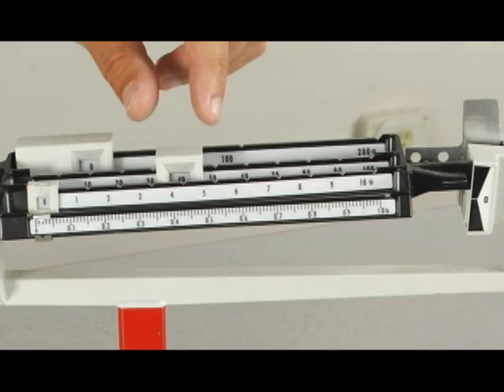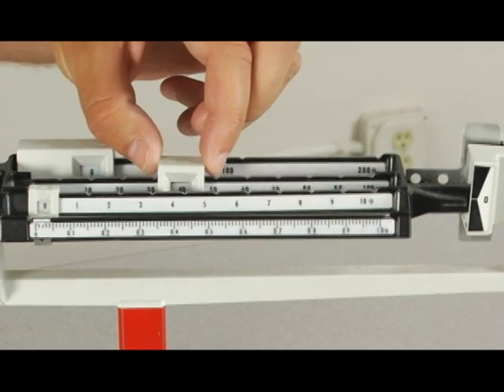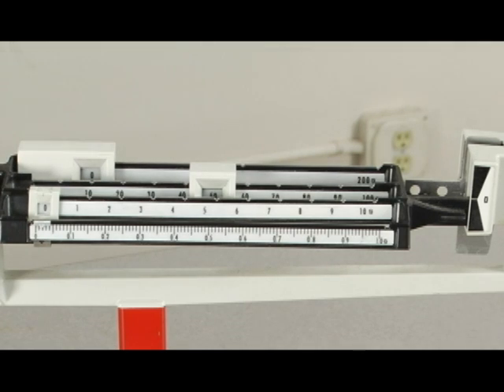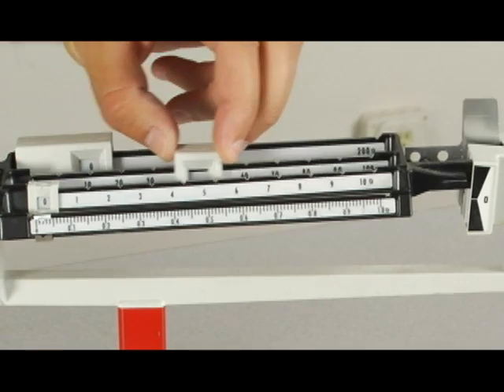Taking the balance out to 40 grams, what happens when we cross over to 50 grams is the balance drops. So what that lets us know is this piece of copper weighs between 40 and 50 grams.